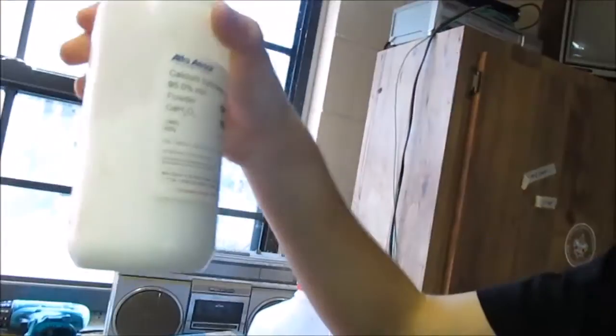Hi, welcome back to Dumb Break. Today we're going to be demonstrating the reaction between copper nitrate and calcium hydroxide. I'm going to be using the copper nitrate I made in a reaction a few days ago, and some calcium hydroxide I had left over. It's a pretty cool reaction, I hope you like it.